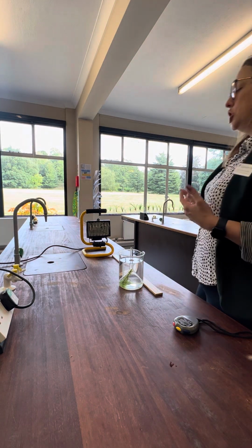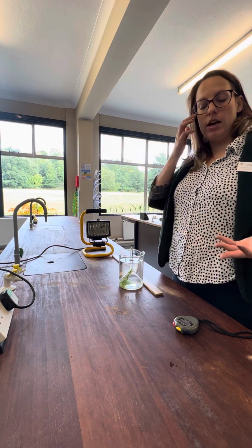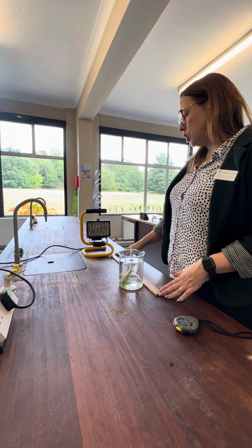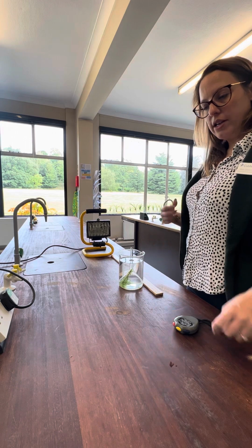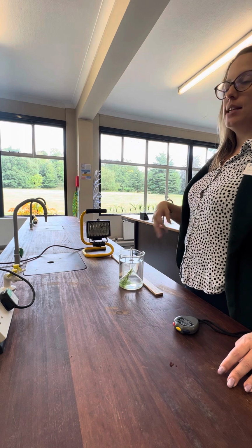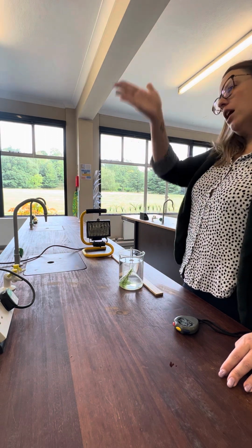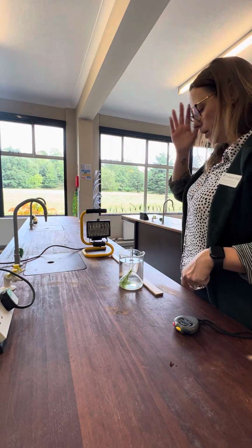Now, there is a relationship between the distance from the lamp and the light intensity. When we're calculating light intensity, we calculate it using the formula 1 divided by distance squared. The relationship between distance and light intensity is something we call inversely proportional. What inversely proportional means is that every time I move my lamp a set distance, my light intensity is going to decrease by half every single time, okay? It's going to change by the same proportion every single time, and it's going to give you a lovely straight line graph, depending on the distances that you're using.